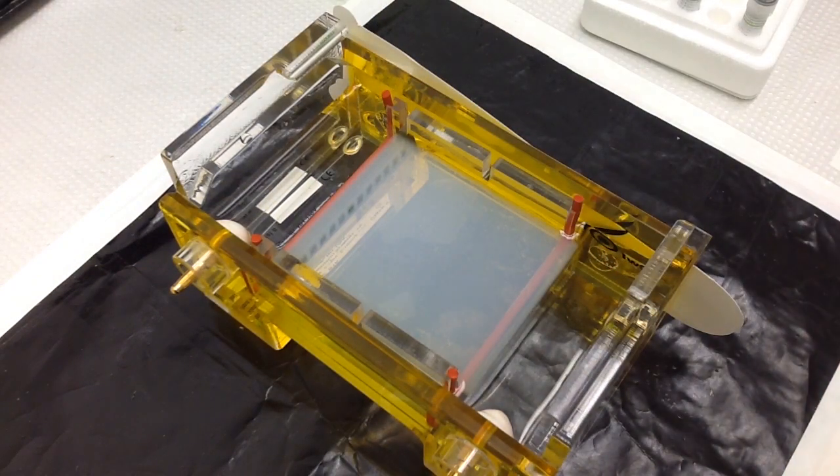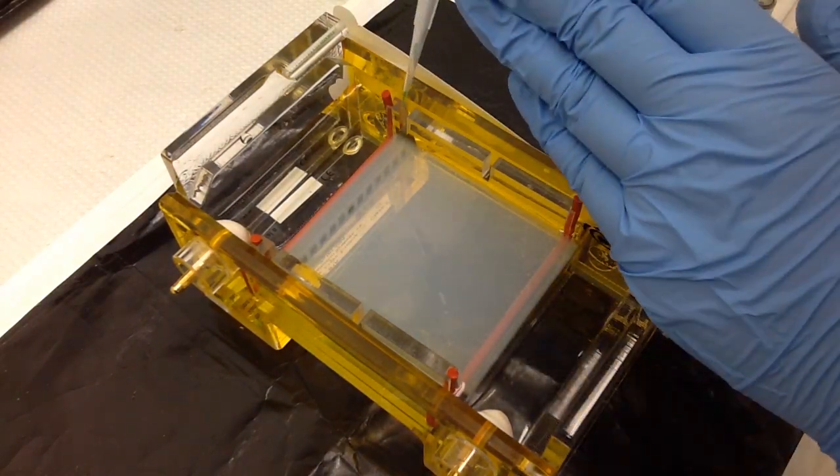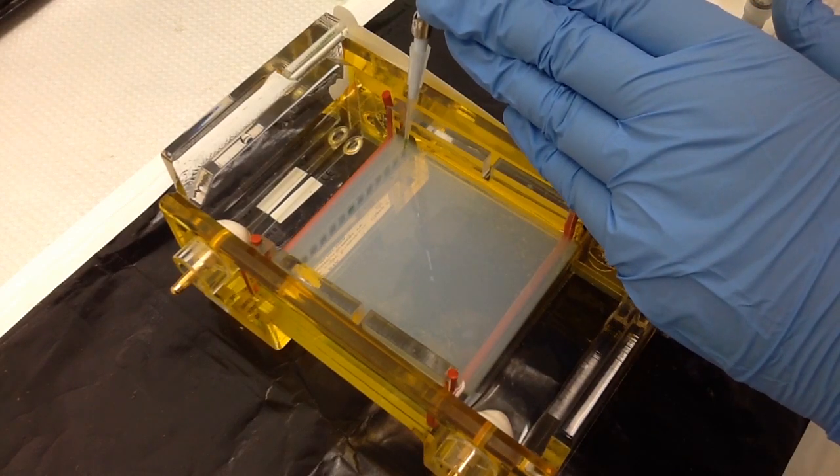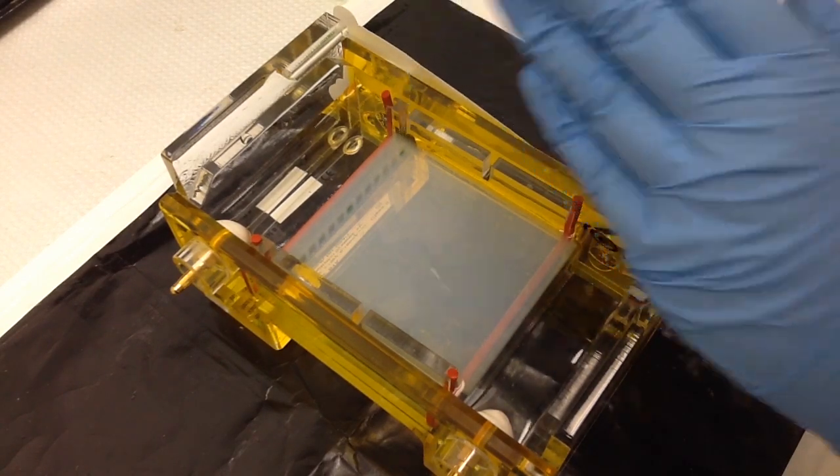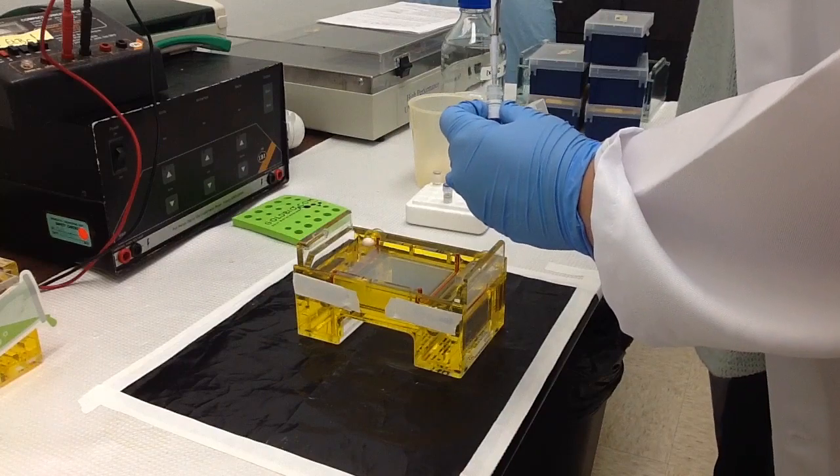Now I am loading our 100 and 100 plus ladders into the gel. Only 5 microliters of each ladder is necessary to load into each of the wells.